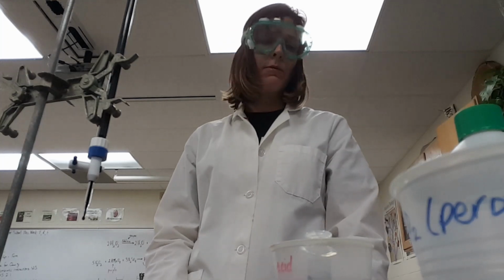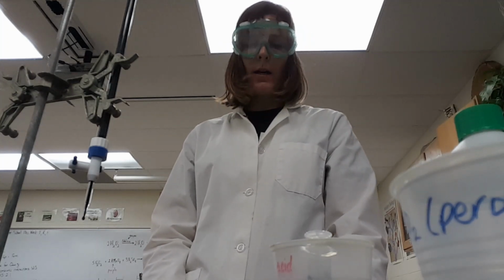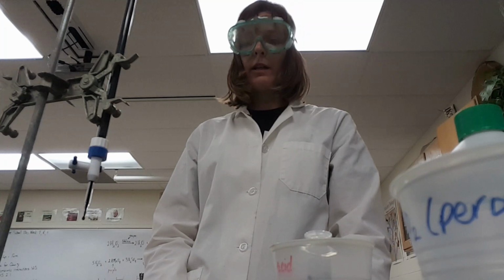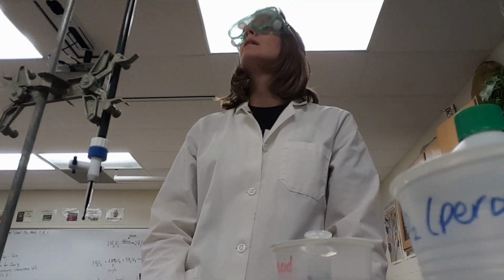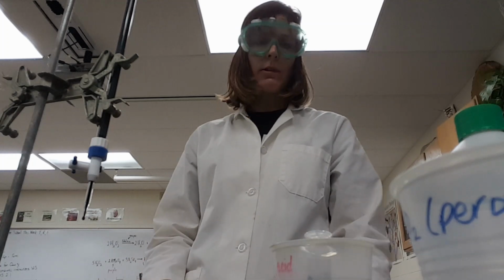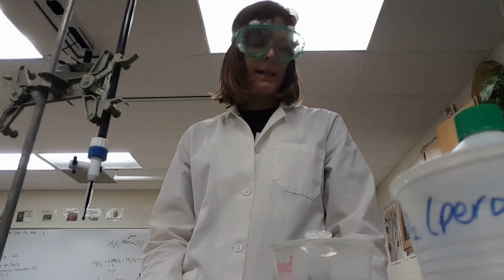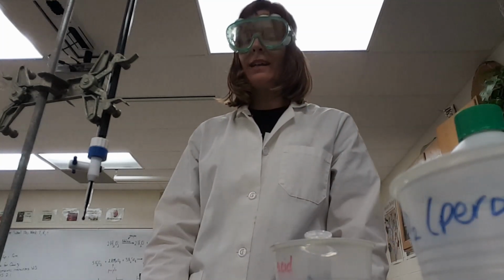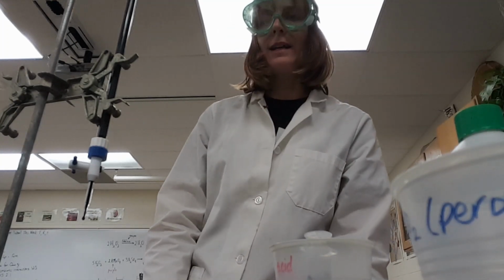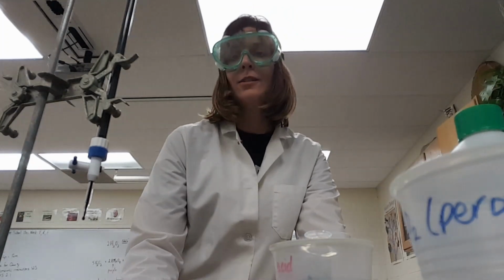But it is a very touchy reaction, and you need to make sure that you're very careful with your measurements and make sure that that's all good. But that's generally how you do this. You're probably going to be testing something like, well, I'm going to let you brainstorm on that. I can help you out in class if you need help on that. All right, good luck.